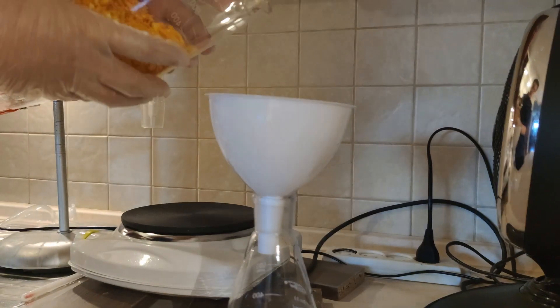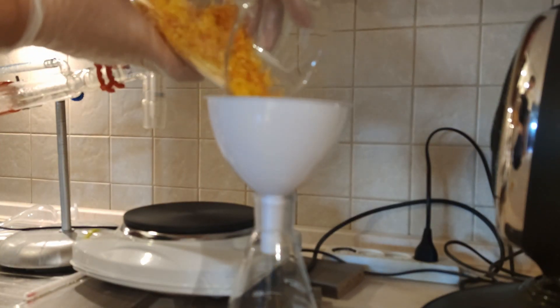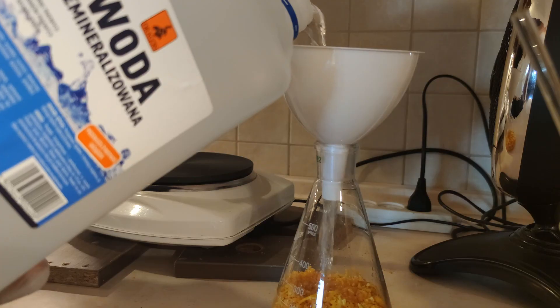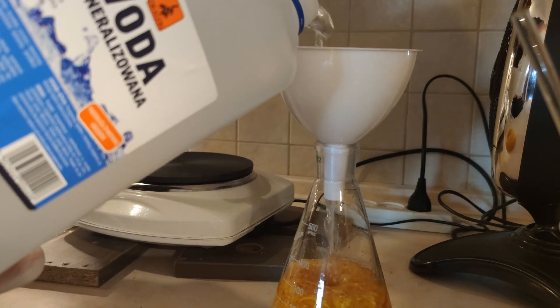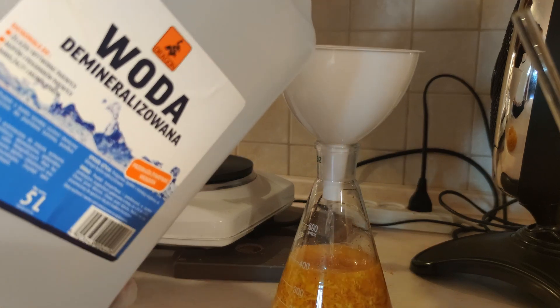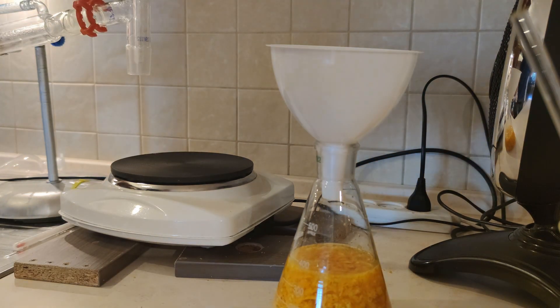After that, I transferred the zest into a 500ml Erlenmeyer flask and poured a random amount of distilled water. I brought the water to a boil and started distilling. Here is some footage of this very satisfying distillation.